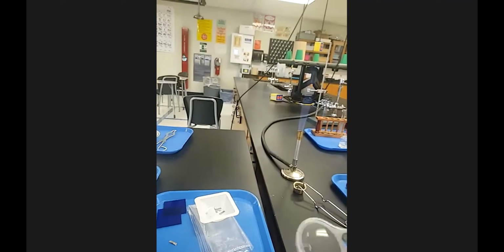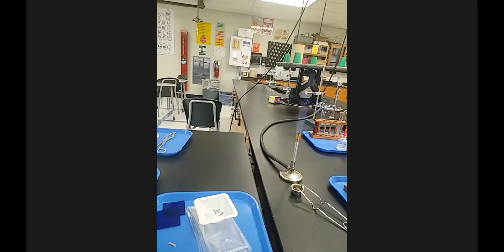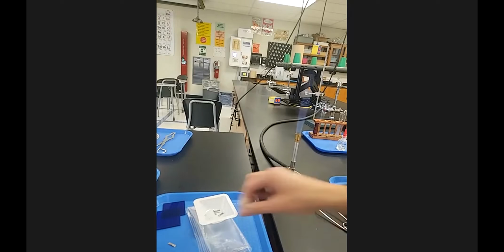So that's the after. The during was obviously, when you saw it, ablaze. It's pretty though. Okay, that's station 2.